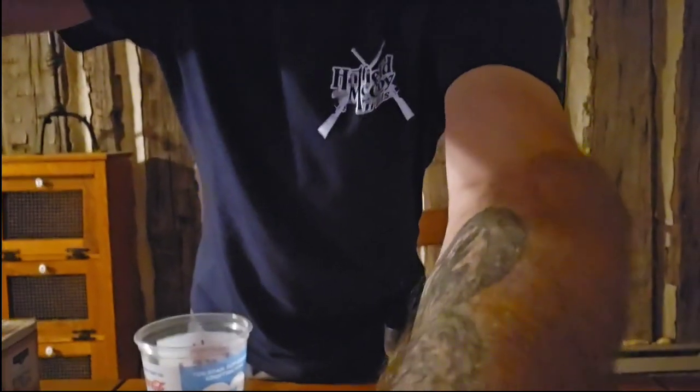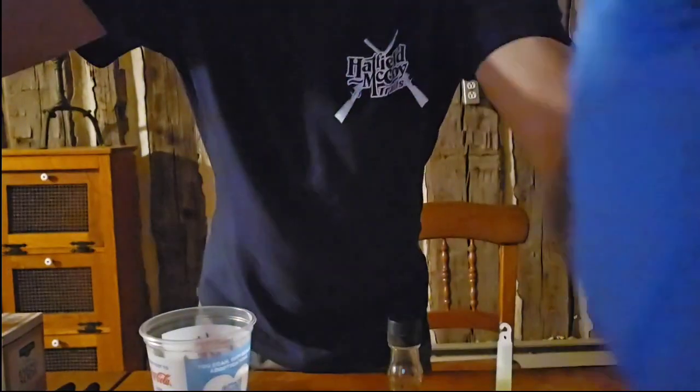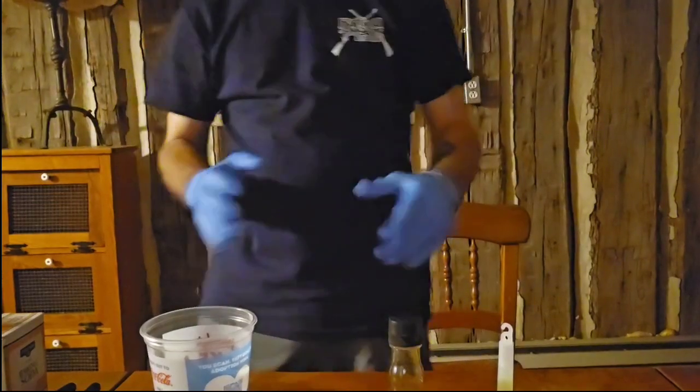I just can't get this to film down where I'm at properly. So we'll see if we can get it to go a little bit better, and maybe you can see it without this thing falling over. Okay, so maybe we could do it that way.